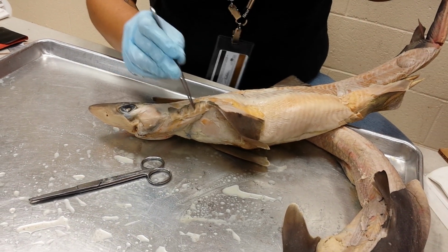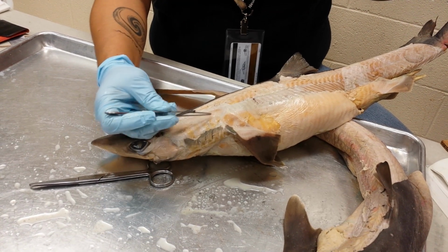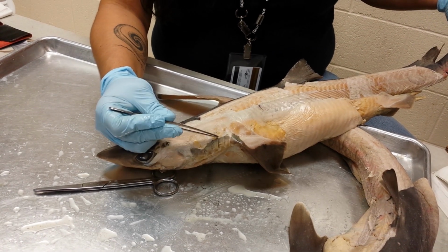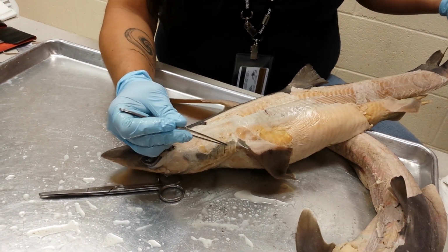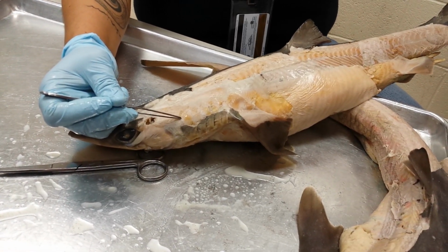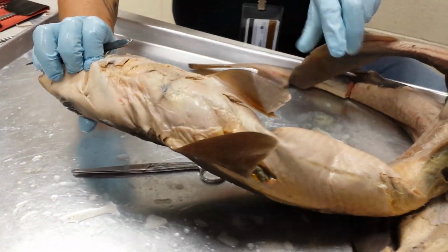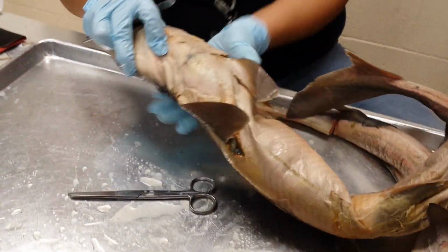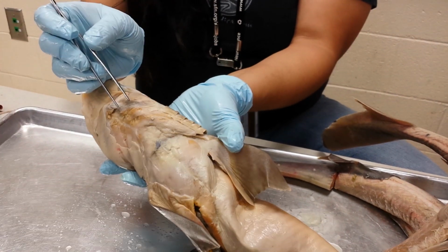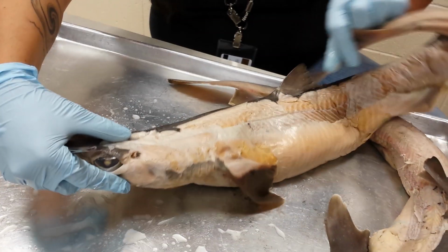Each of these gill slits is controlled, the opening and closing, by a series of muscles. If you look on the dorsal side of the gill slits, you'll see strips of muscles that correspond to each of these flaps. These are your dorsal superficial constrictors. They close the upper half of these gill slits. Your ventral superficial constrictors are the same, but on the ventral side, there are strips of muscle that correspond with each gill slit.